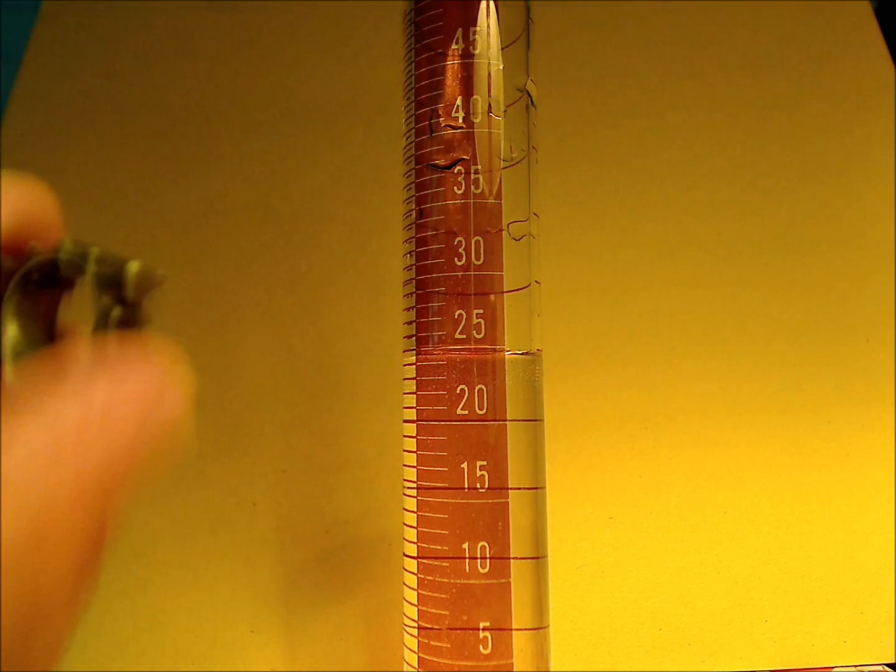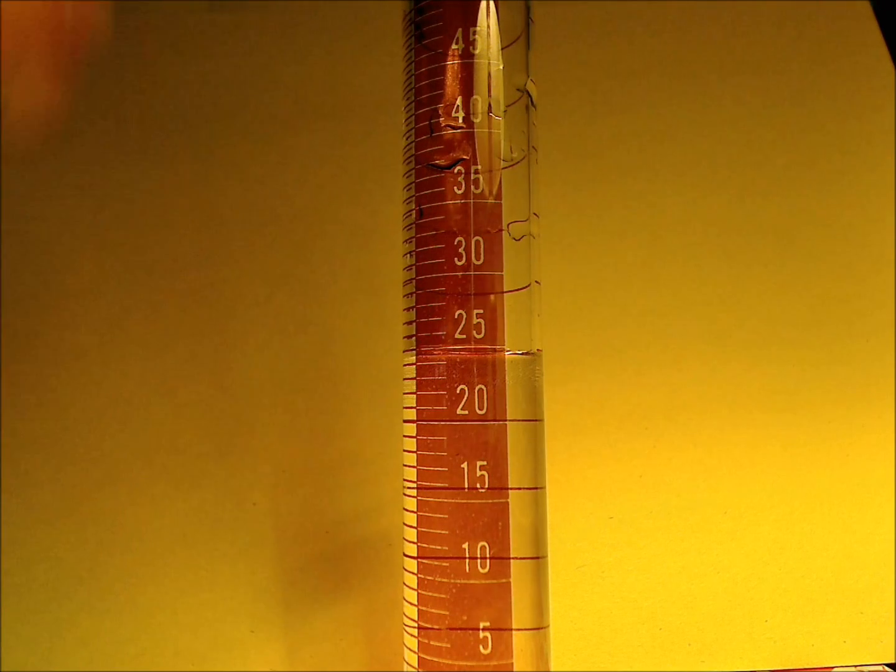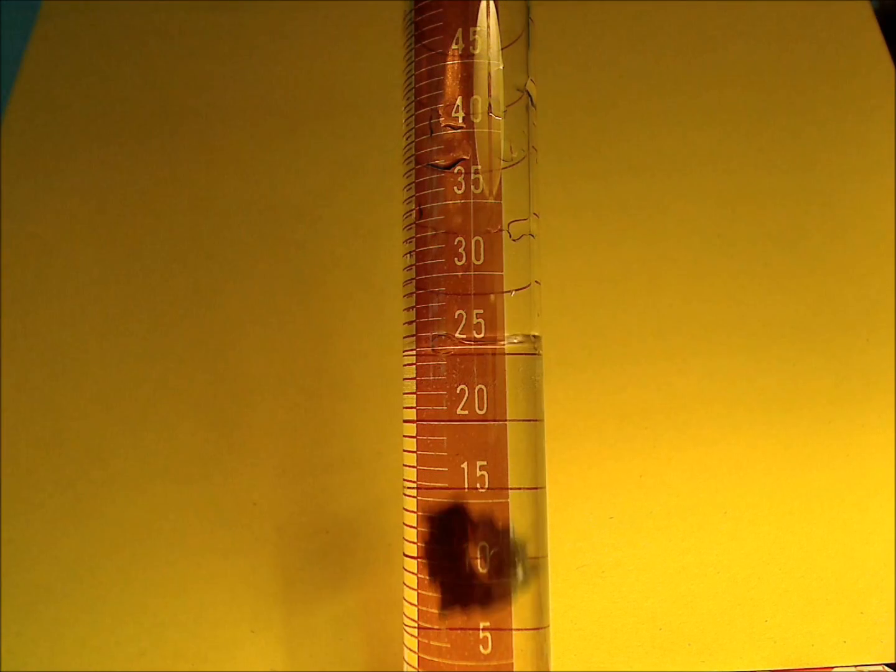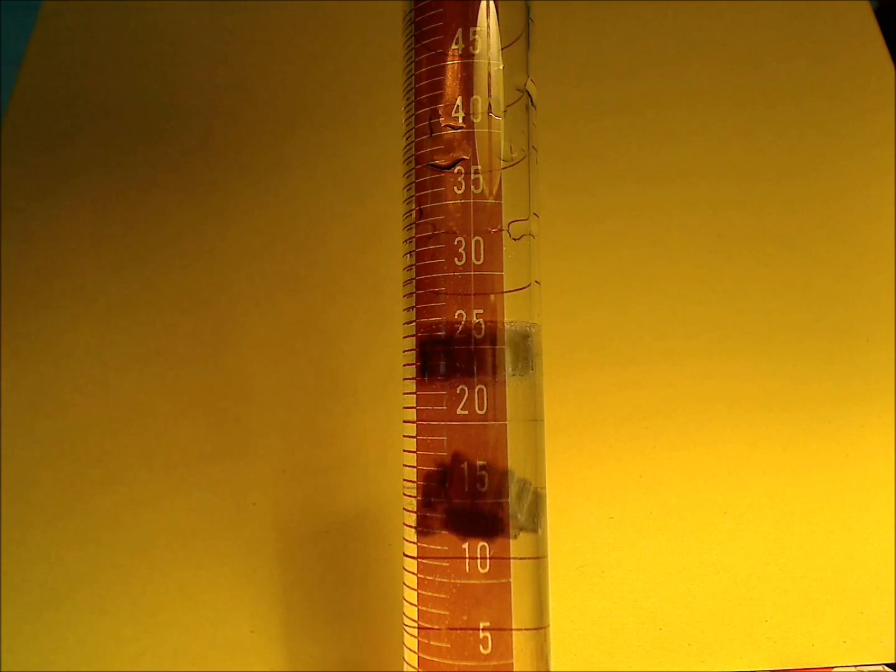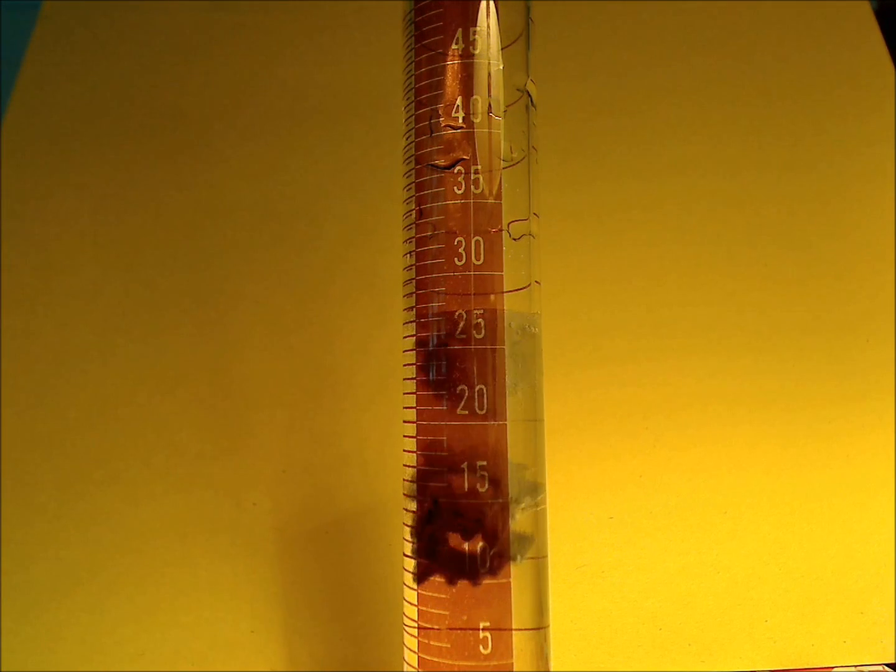I'm going to introduce the platinum discs, this is platinum coated discs, into the solution. I'm going to introduce three of them to make it go nice and fast, but it works with just one.